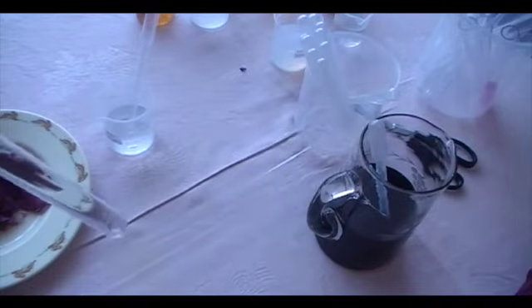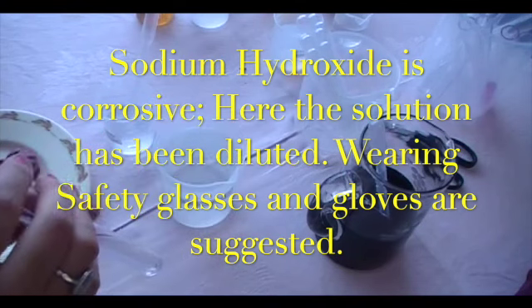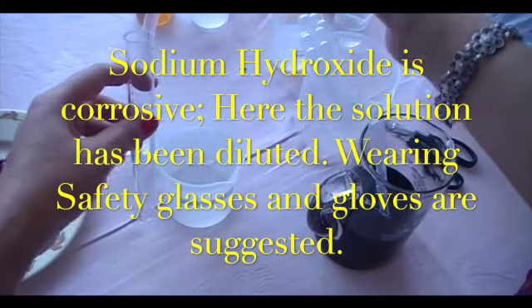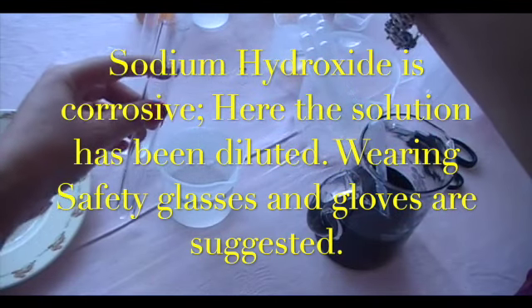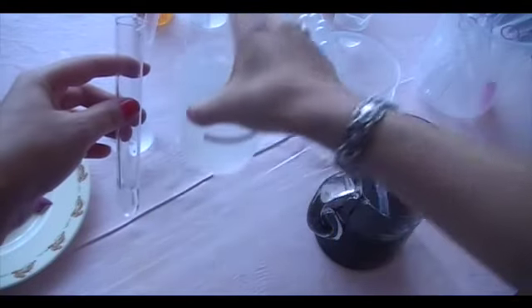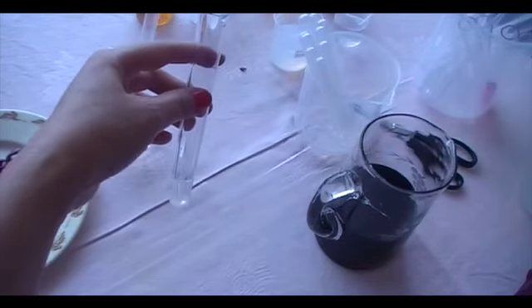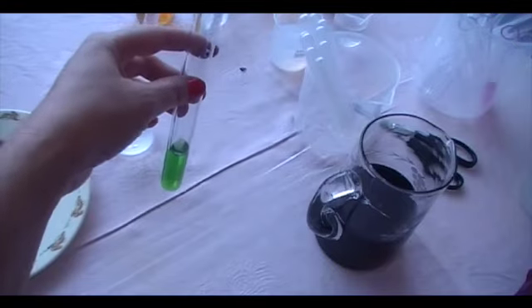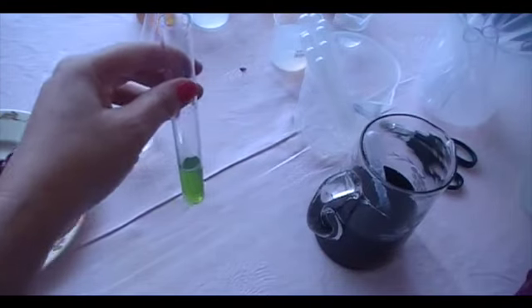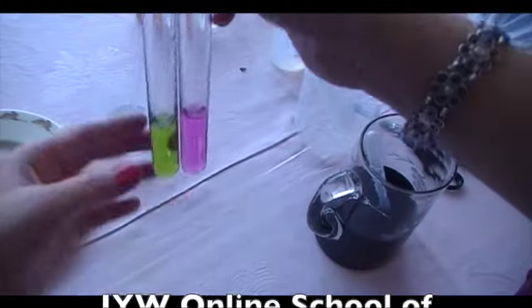If I have some sodium hydroxide solution, let's say here, sodium hydroxide solution, add into the test tube, and then I'm adding a little bit of red cabbage solution. Can you see the color? It's a beautiful green. So if it's acidic, it's red. If it is alkaline, you see it's green.